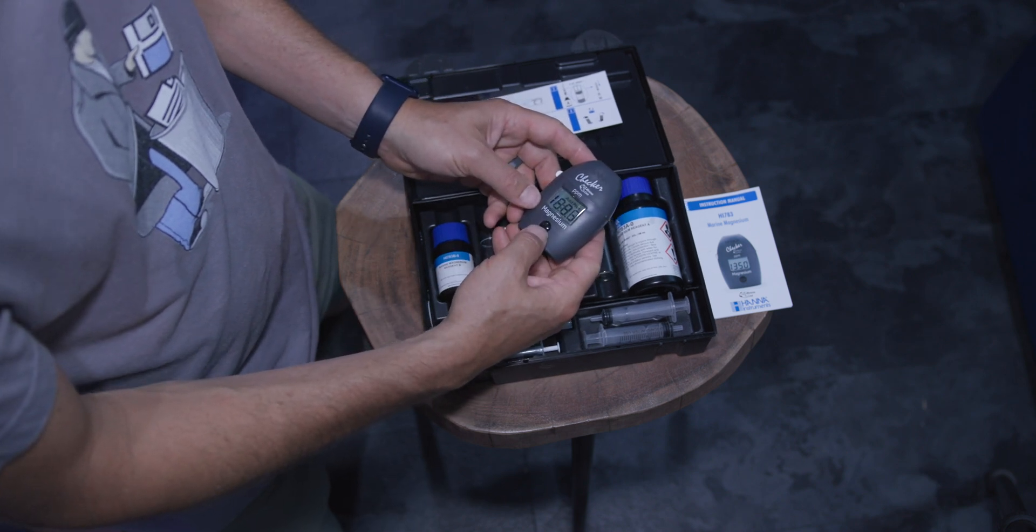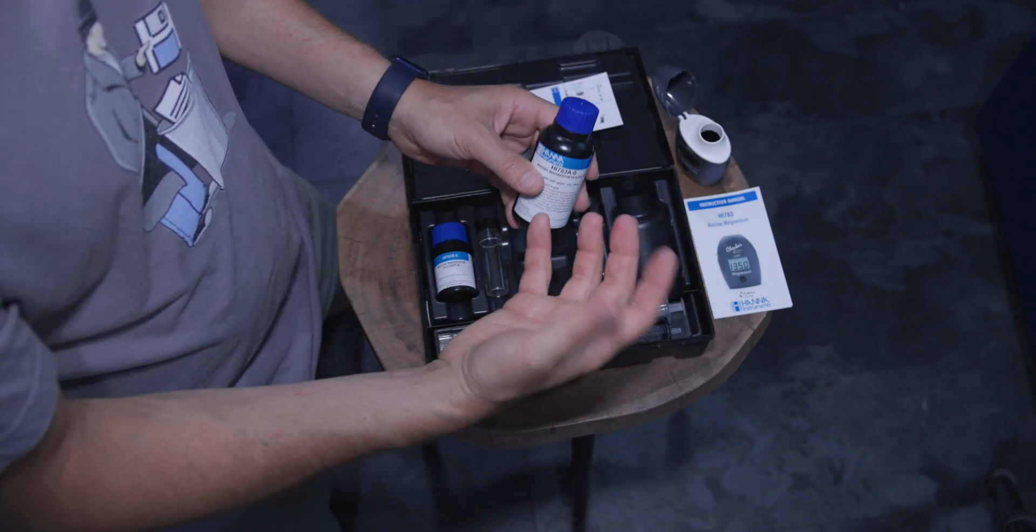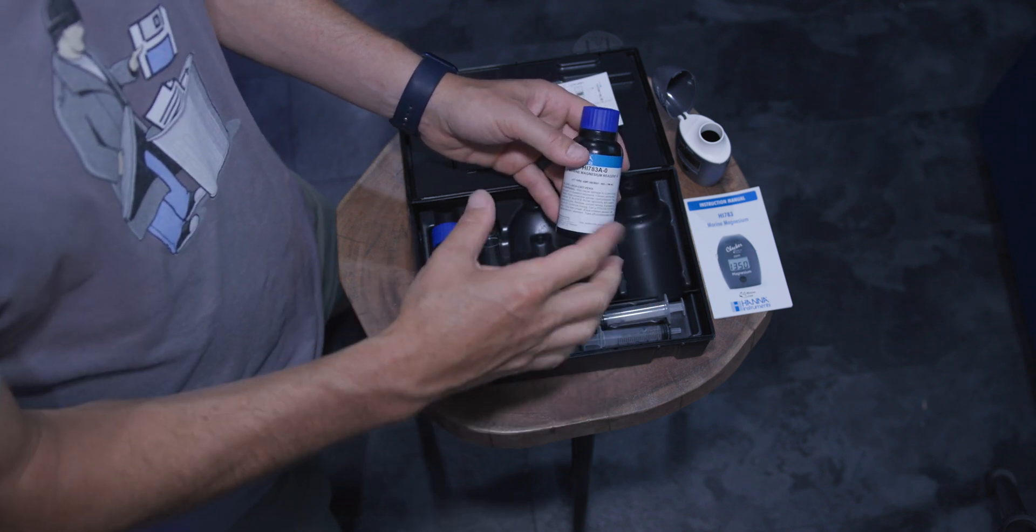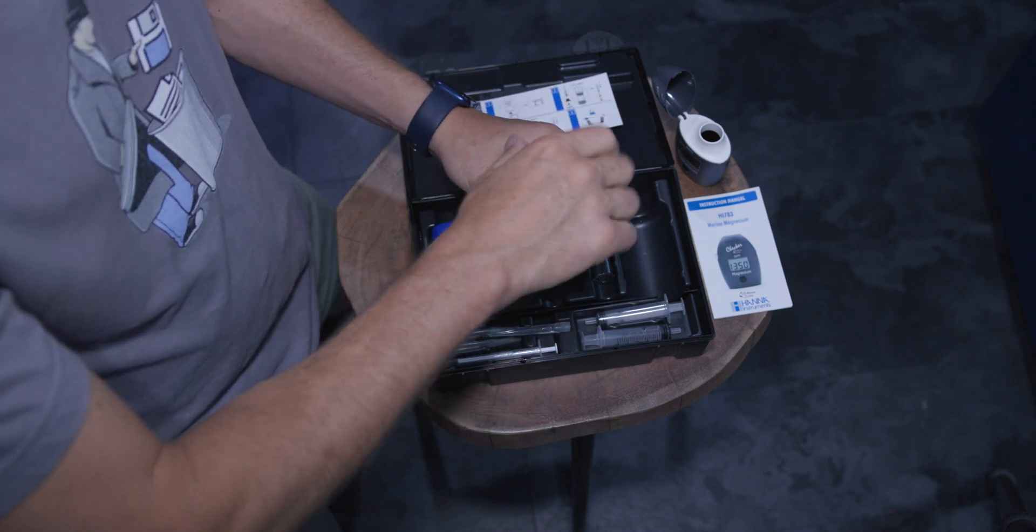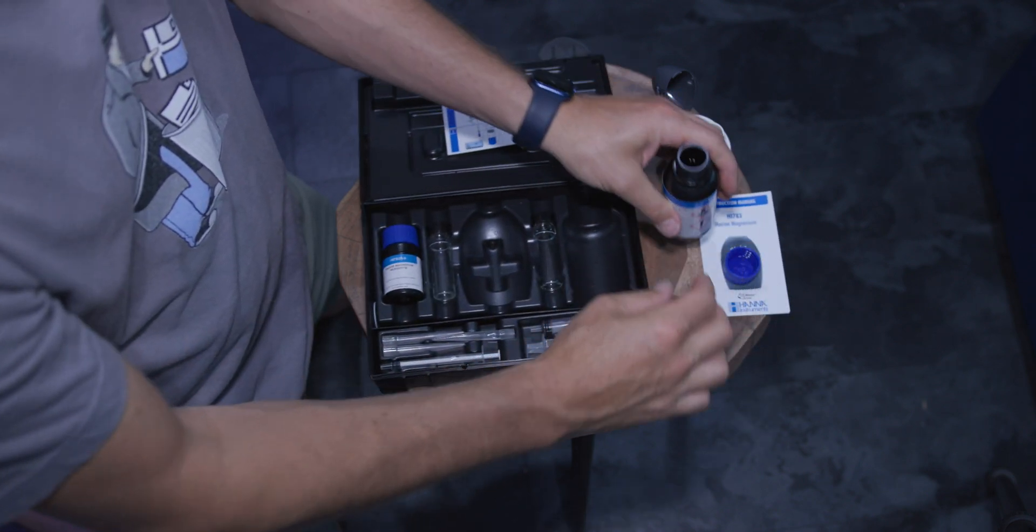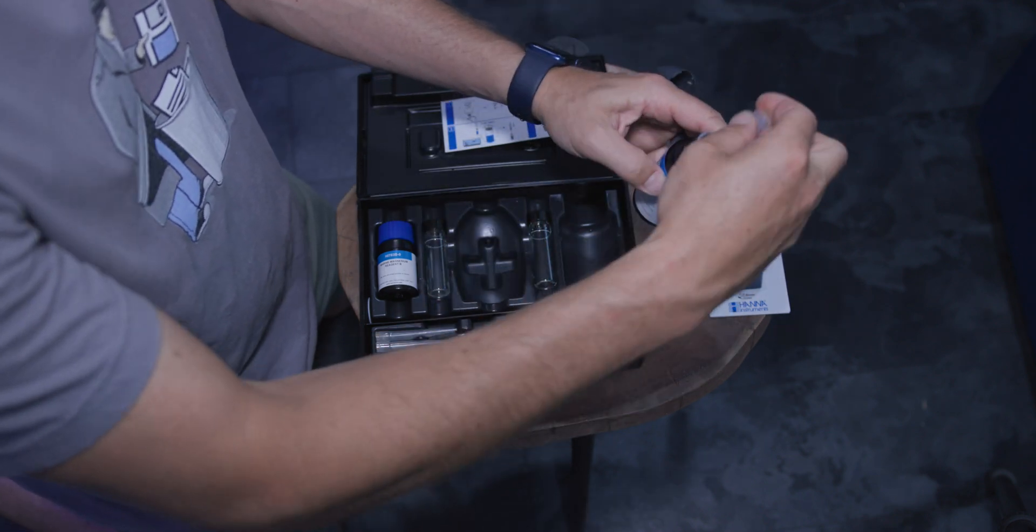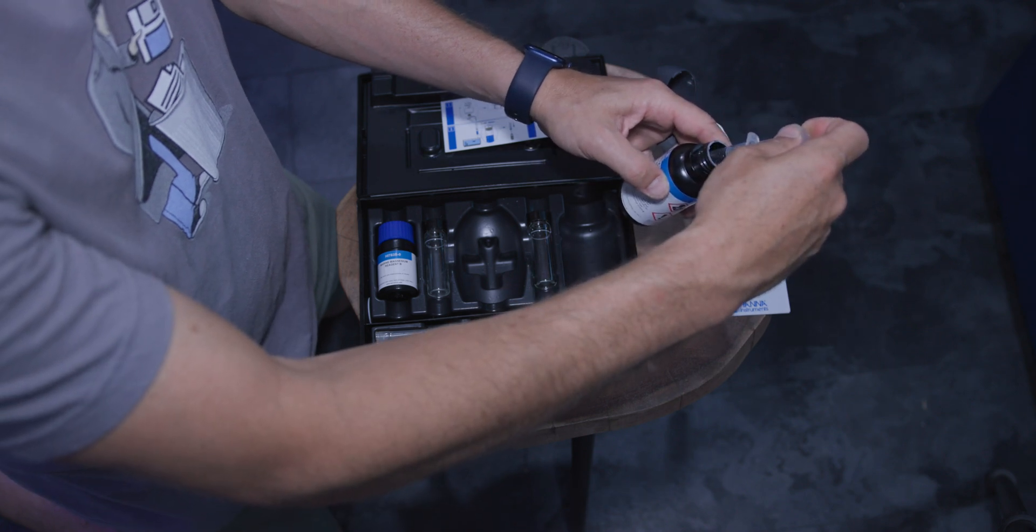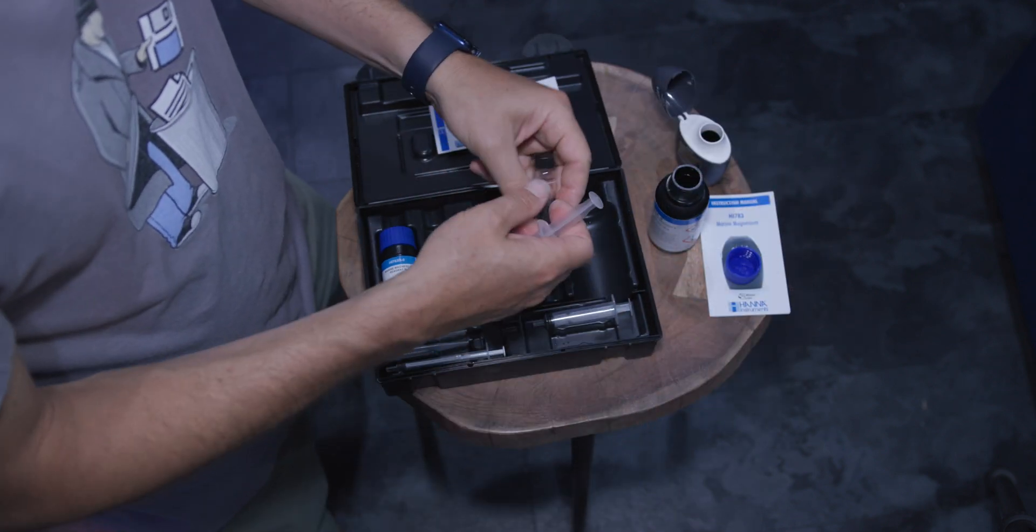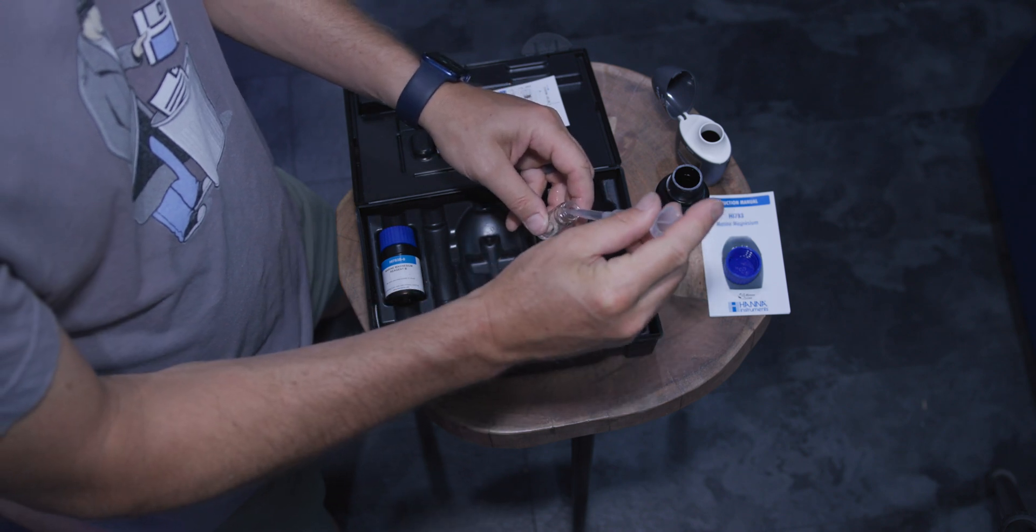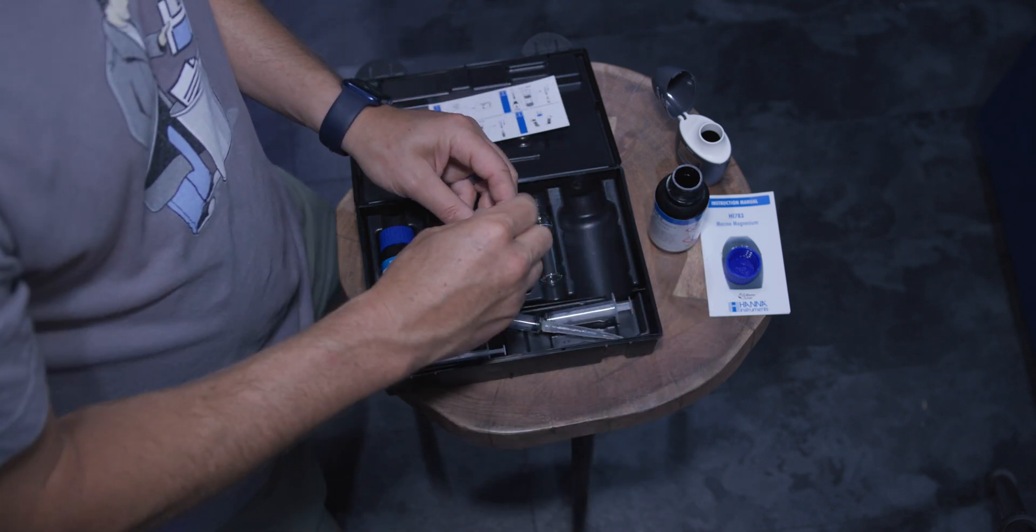Power this thing on. Add C1. Now, I would think that we're going to add a sample of water, but it says no. The other thing I'm noticing in this kit is there's no powder or packet reagents. There's liquid and there's liquid, which is great. It's much easier to deal with than dealing with powder. All right, so we're going to grab a syringe. We're going to grab a tip and four mils. Slowly pull up four mils. That's that. We're going to grab a cuvette. Four mils in. Done.